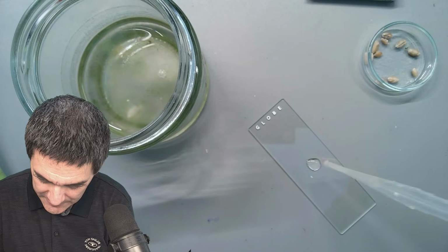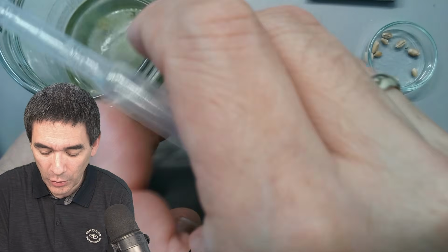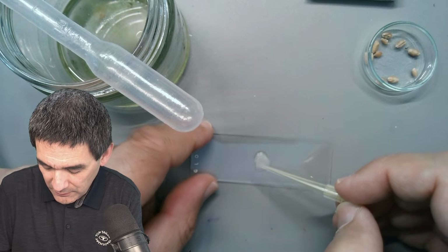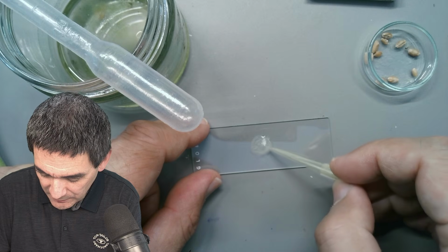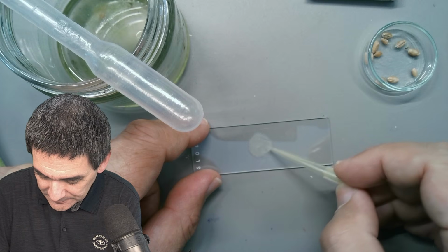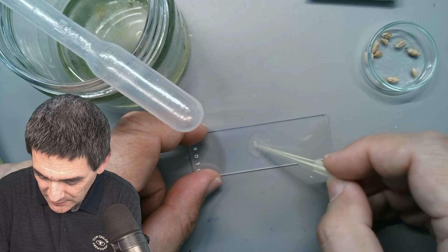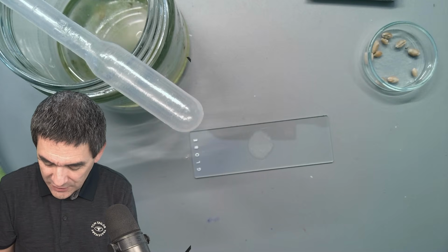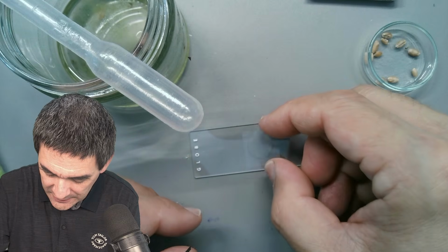Okay, add a drop here. Look at this, how white it looks there. There are going to be so many starch grains on here, and very important, something that I once overlooked: you have to mix this to really make sure that the methylcellulose is in contact with pretty much all of the ciliates here. Okay, it's still pretty thick. There's probably way too much starch, I think. Okay, who cares? Let's try it anyway. All we care about now is simply to see a few of those, and then hope.